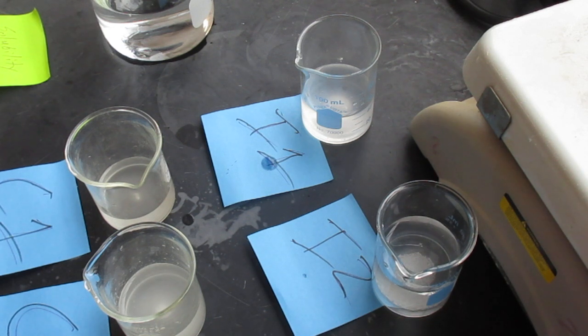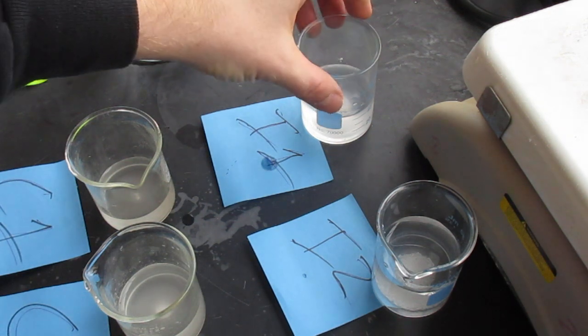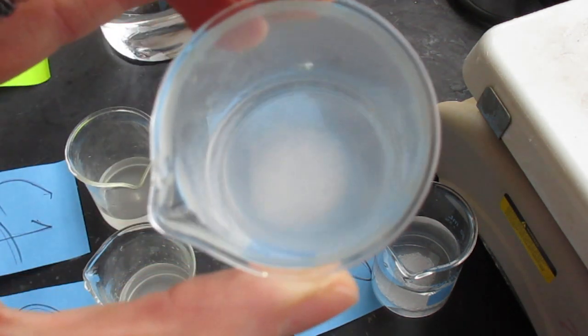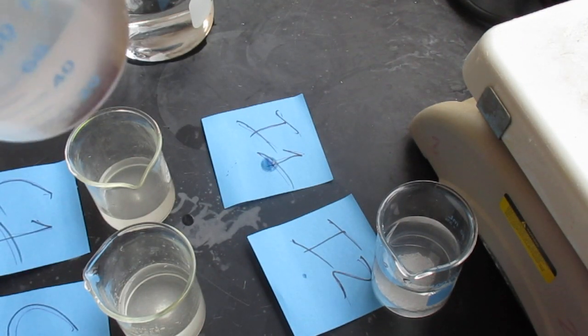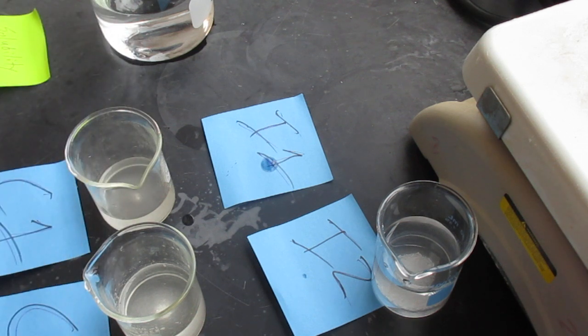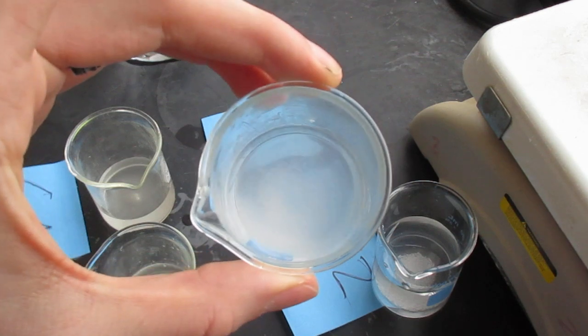And let's look at kind of what's going on. Ionic number one, clearly that is a lot less than original. This is dissolving, and I know that because there is clearly less in here.